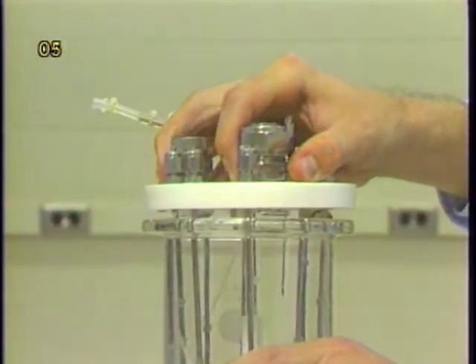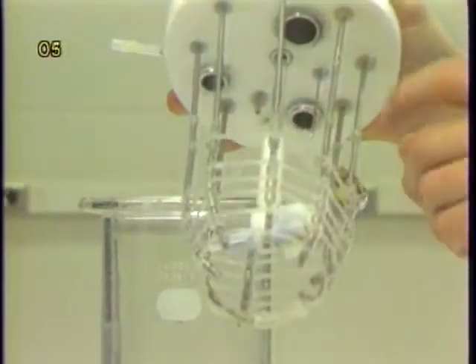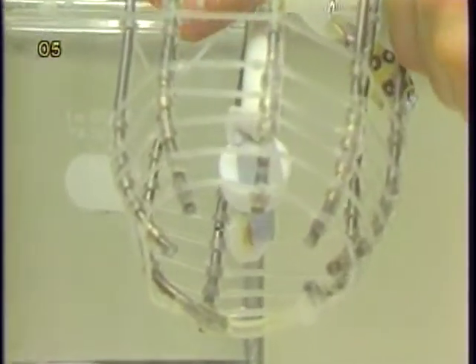With a marine impeller or the pitched blades, the fluid can be pumped either upward or downward. Our observation with 1 to 2 liter vessels revealed no difference in cell growth whether the fluid was pumped either upward or downward. However, we feel that pumping the liquid upward is better.